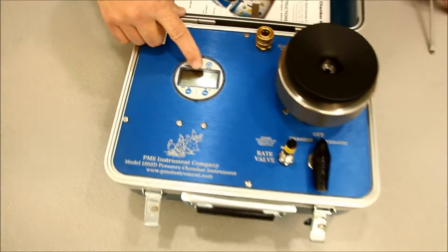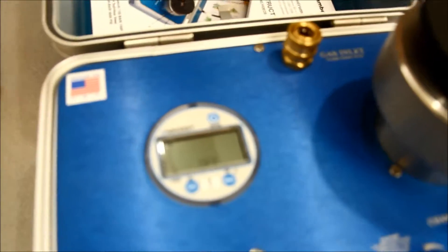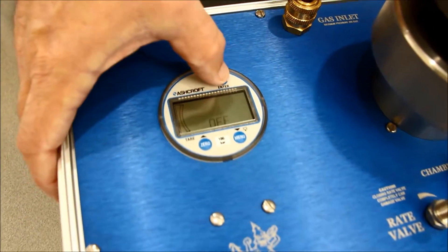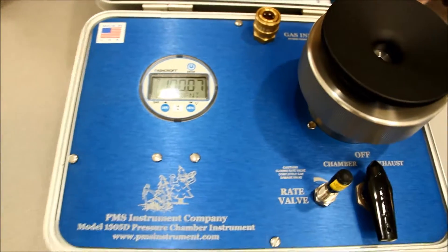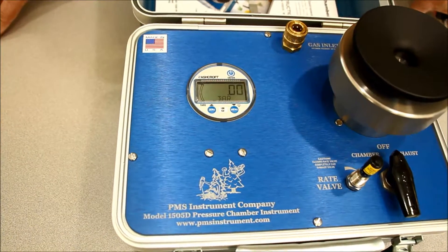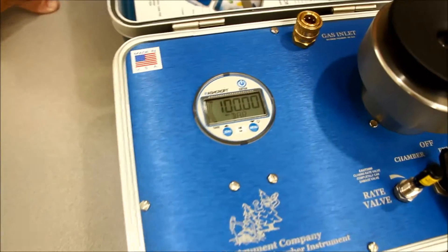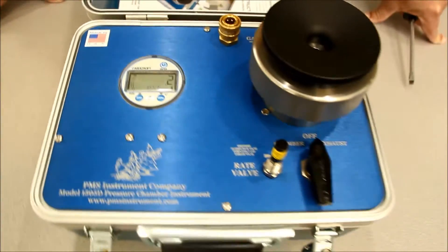You can check here, and we show it's already off, so we know we have a good battery source. But if you weren't sure, you could turn it on and run it through the cycle and check how much charge there is. You can see we've got a full charge on that. And that's it.